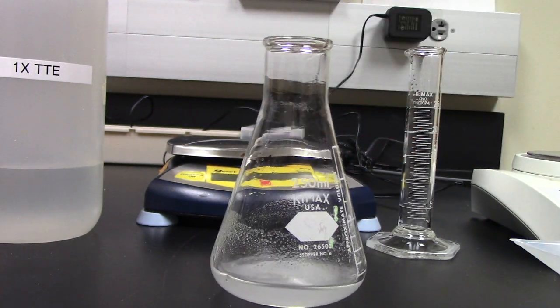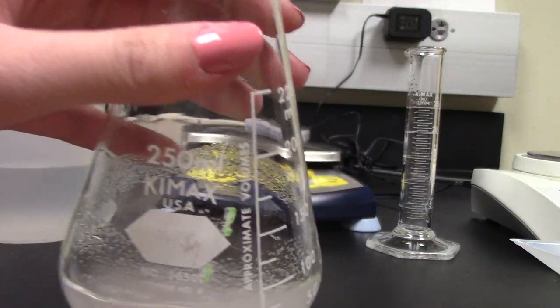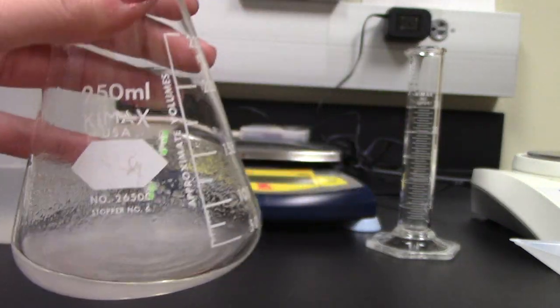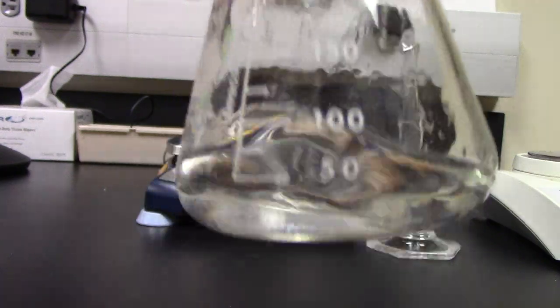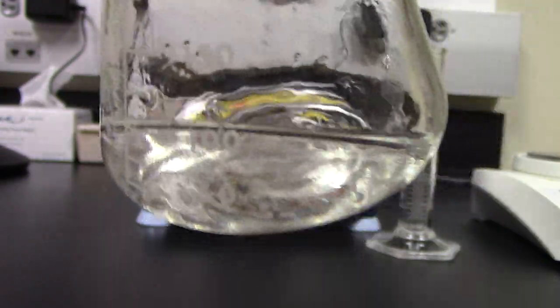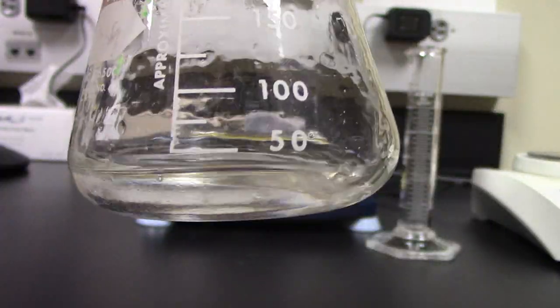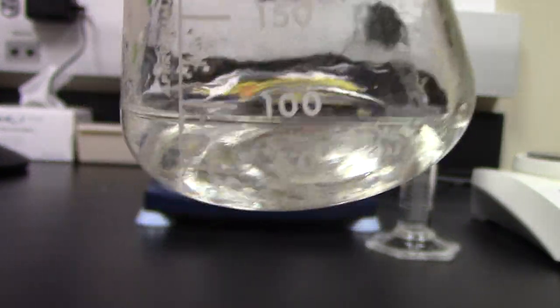I am now going to microwave this for about 30 seconds until all of the everyday agarose dissolves. All of my agarose has dissolved and now I'm going to wait until it's cool enough to touch before I add my dye.